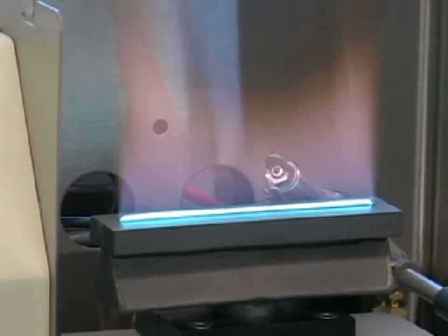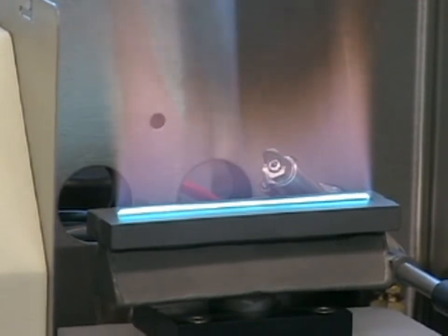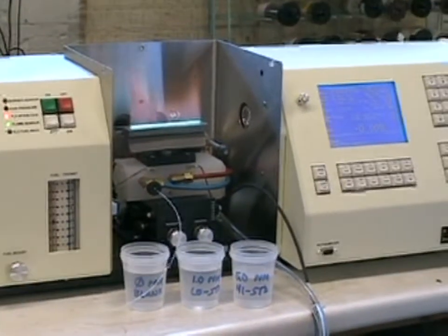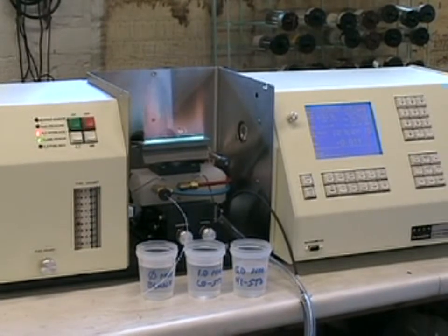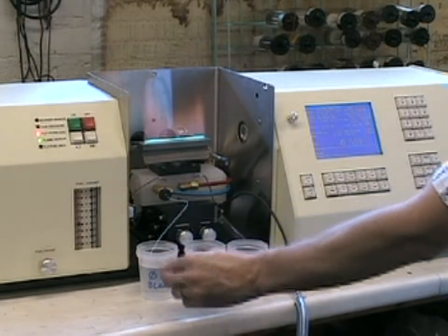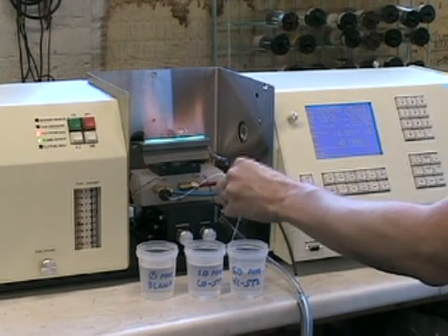approximately 2 millimeters high. And again, this is the standard setting for most of the elements done with acetylene flame. Prior to going into our calibration screen, it is a good idea to check the energy of our standards by going into the blank and pressing Auto Zero, just to zero out any particular background that we may have, and then going into the high standard and making sure you get some absorbance reading.